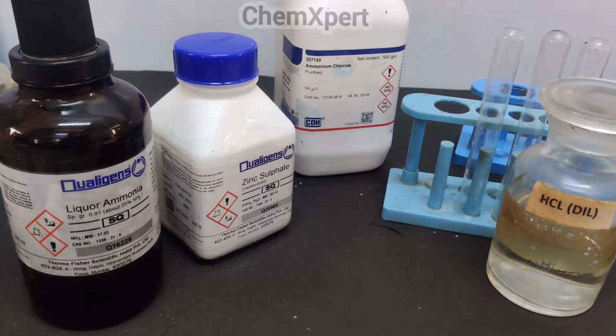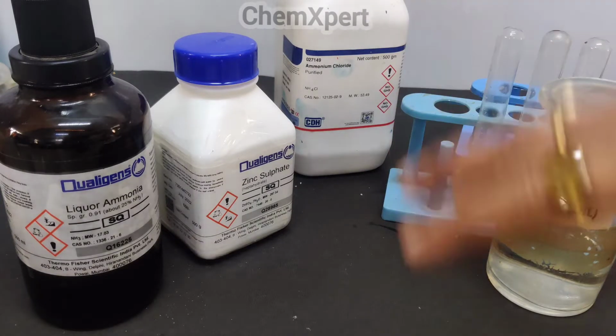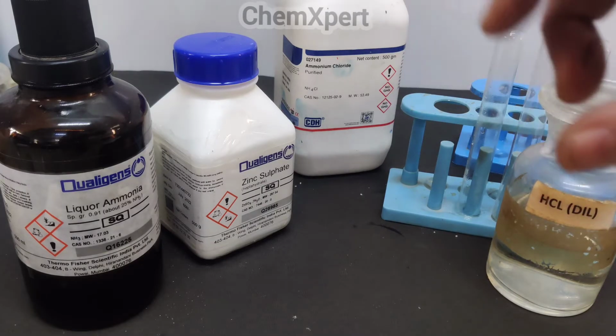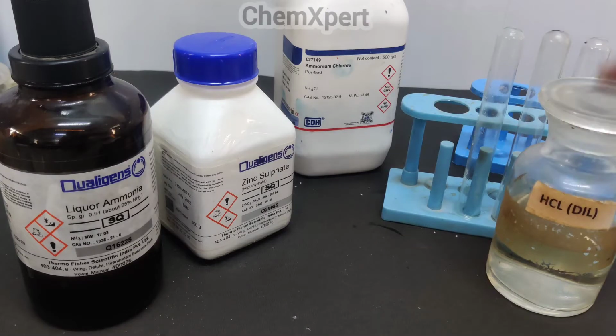Hello everyone, in this video we will perform the confirmatory test for the zinc ion, that is a group 4 cation. But when we reach this point, we have already shown the absence of 0, 1st, 2nd and 3rd group. So let us recall all the tests for groups 0, 1, 2 and 3.